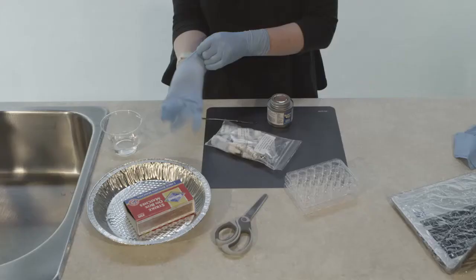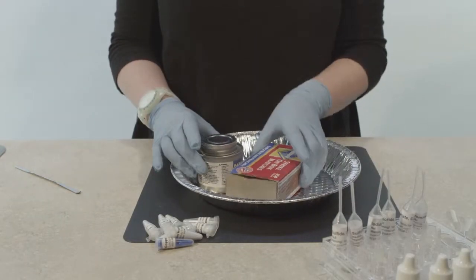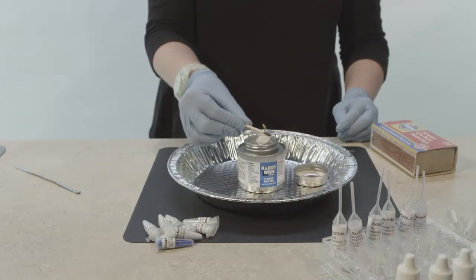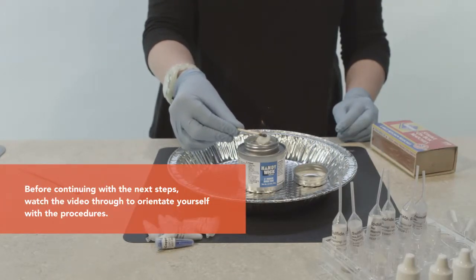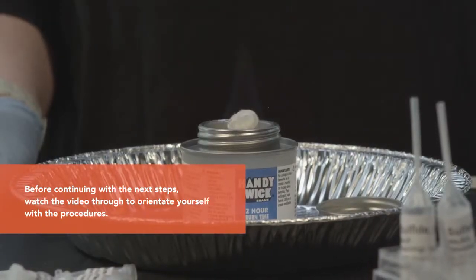Put on your safety goggles and gloves. Place the burner fuel on the pie plate. Uncap the burner fuel and light the wick with the matches or lighter. Before continuing with the next steps, watch the video through to orient yourself with the procedures.